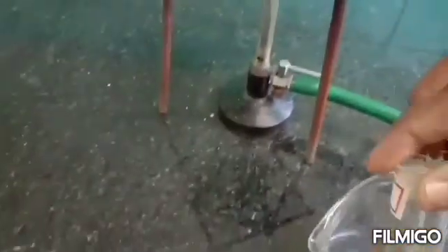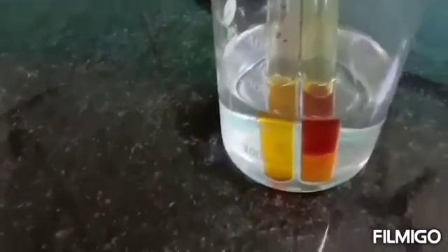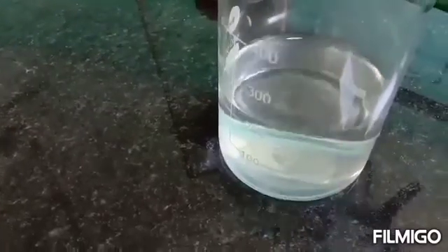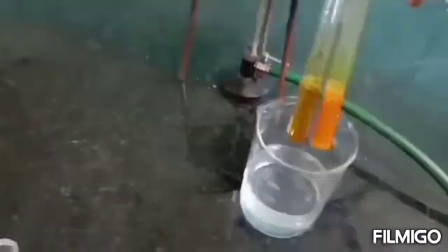After 30 to 40 minutes we can take out maltose and lactose, cool them, and we can clearly observe the precipitate in lactose. But in maltose it is not observable with the naked eye, though there will still be crystals which can be seen under the microscope.